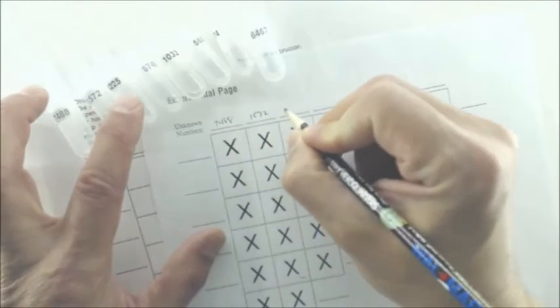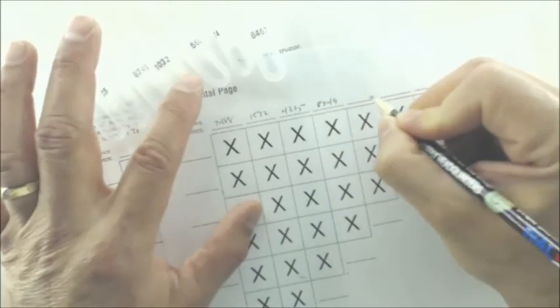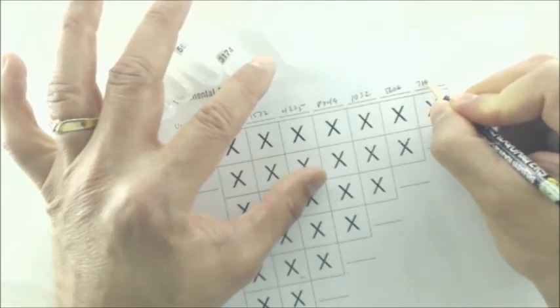Let me get back to an autofocus here. I can go in a little bit. So this is 7488 right here, and this is 1572, and this is 4225, and this is 8749, and this is 1032, 5606, 3174, and then the 8th pipette. That's 7 of the 8 pipettes, and then the 8th pipette, number 6467 in this case, needs to go around the corner right here. That's 6467.